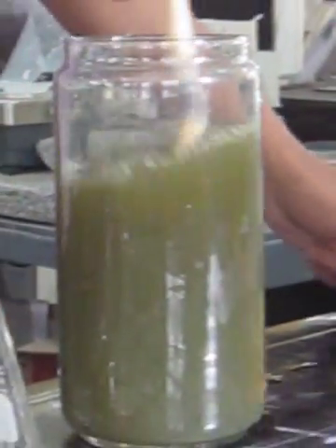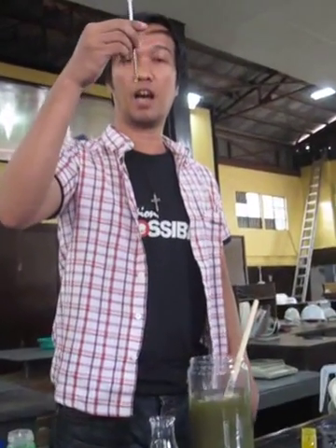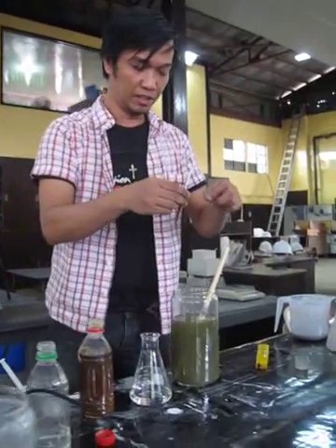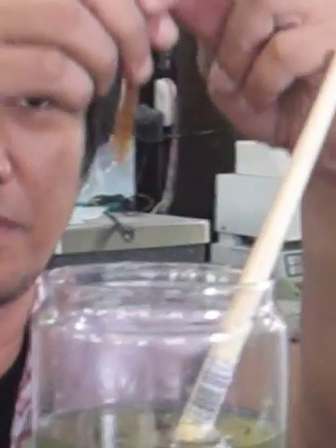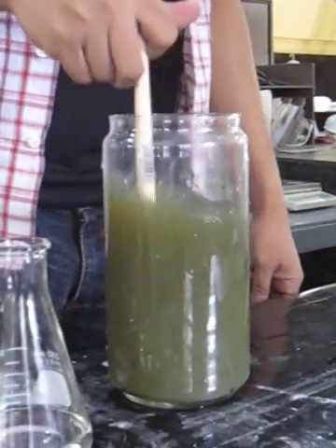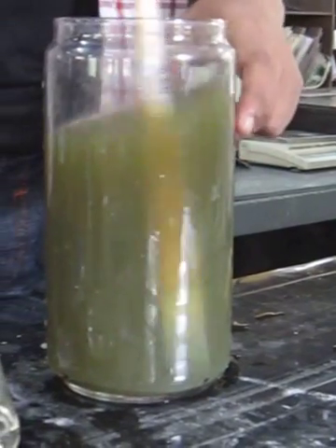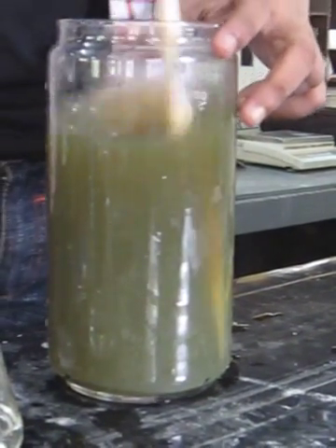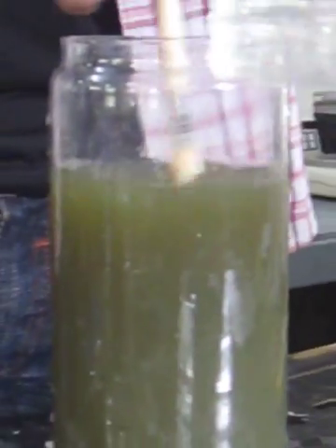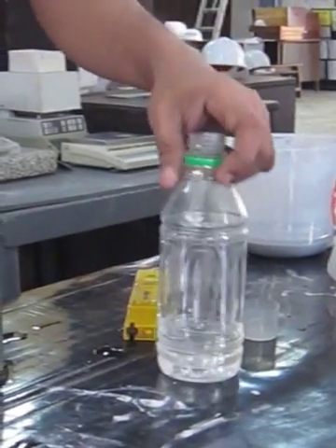There's 8.3 — we're going to shake it well. And this time we're going to add our product. This is our product — it's a cationic coagulant — and we're going to add just one drop. The product will ionize the solution and give it a positive charge, so that later when we add the polymer, there will be an attraction of forces, like a magnet.